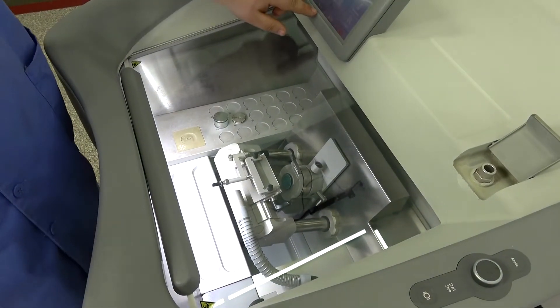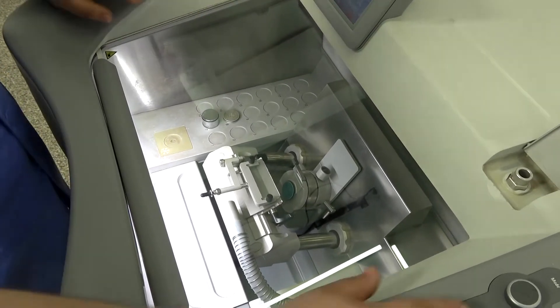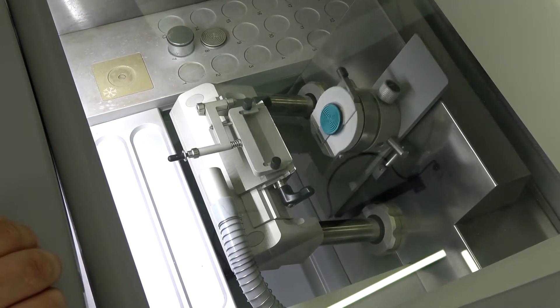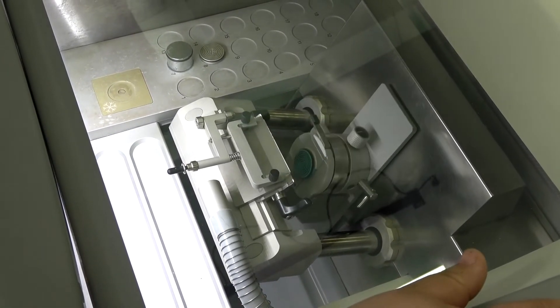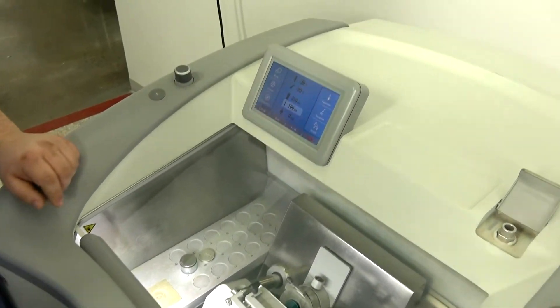This will do numbered cuts, continuous cutting. So this continuous cut here will just keep going until you say stop along with a few other options.